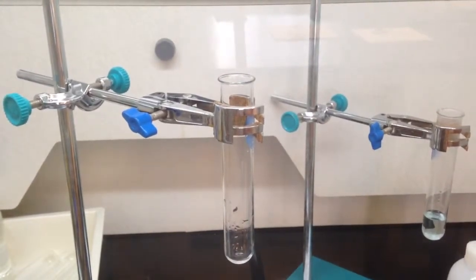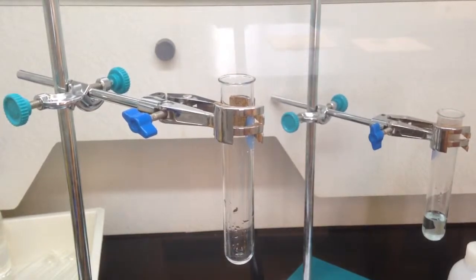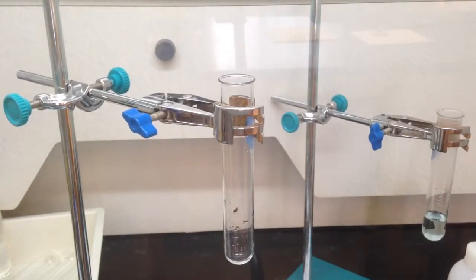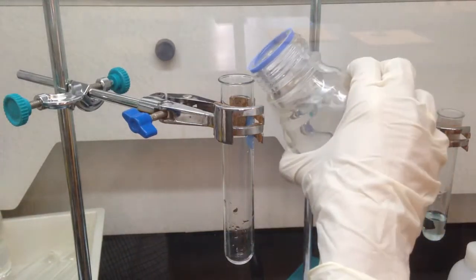In this video, I would like to show you how copper metal reacts with concentrated nitric acid. Concentrated nitric acid is known as a strong oxidizing agent, meaning it can oxidize others very easily. So let's look at it.